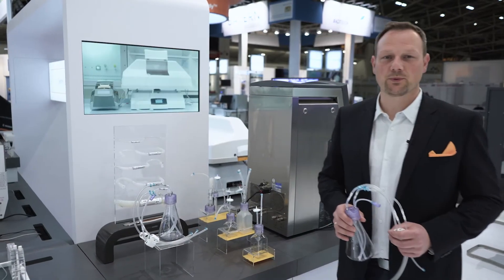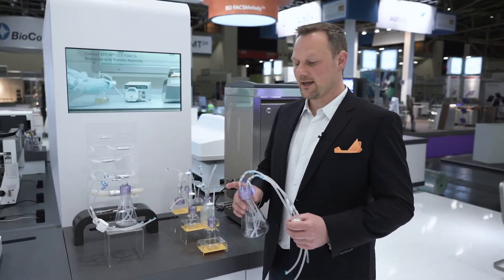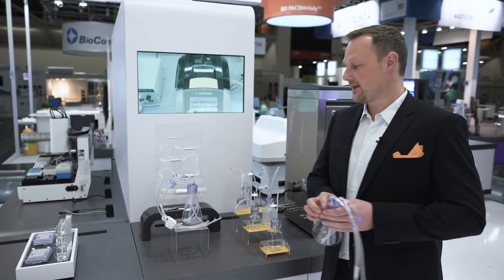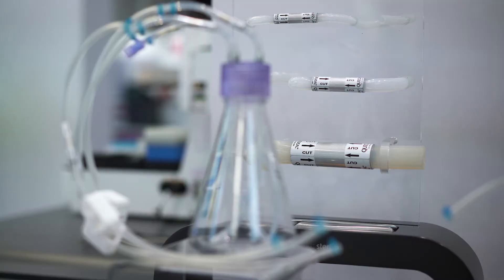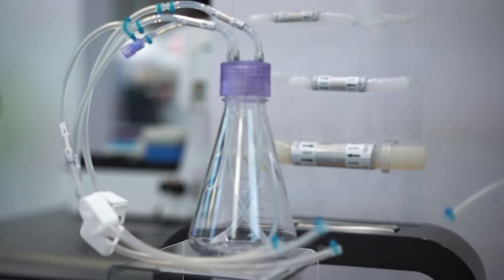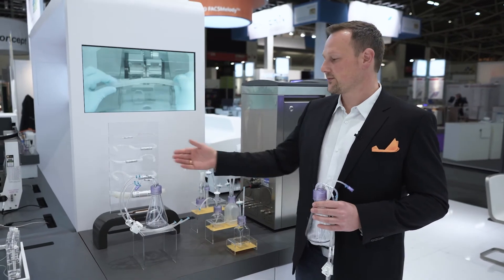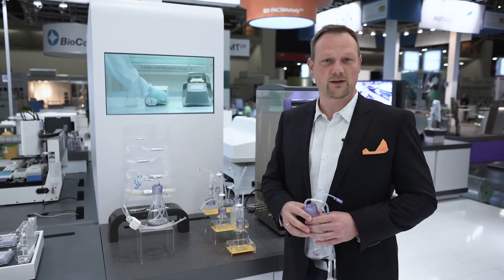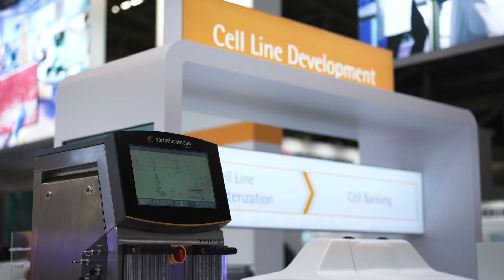The last product group we want to highlight as part of cell line development are our smart consumables — namely Quikseal, MyCap and MyCap CCX. All of this is used for aseptic handling of fluids, or in the case of MyCap CCX, for cell cultivation without laminar hoods.